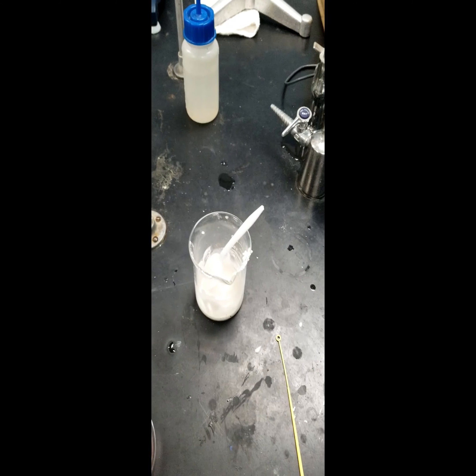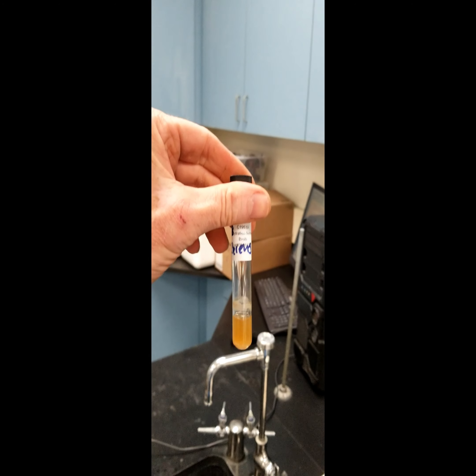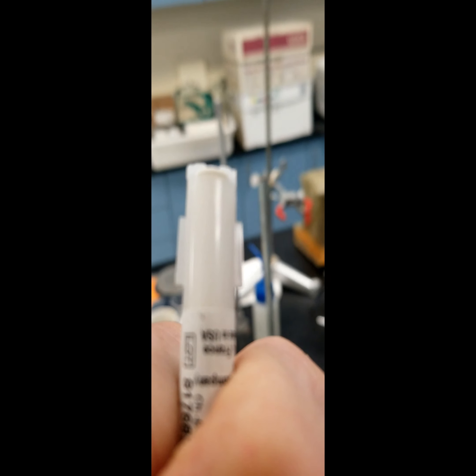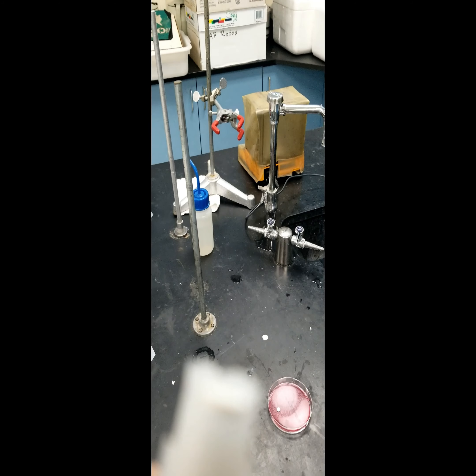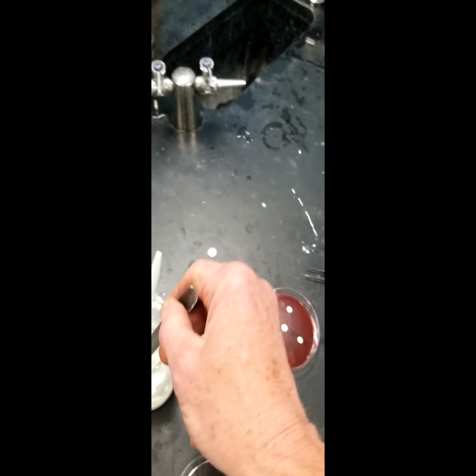So we can test our sulfanilamide against some other antibiotics. We are going to inoculate a petri dish with some Bacillus cereus. To test our sulfanilamide, we will compare its effectiveness to four other antibiotics. We are going to use tweezers to aseptically transfer the Sensi discs to the media plate, pushing each one of the Sensi discs down into the media. Now we're going to put a little bit of the sulfanilamide that we have prepared in the very middle of the media plate.